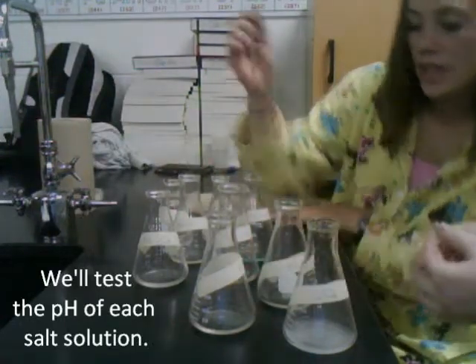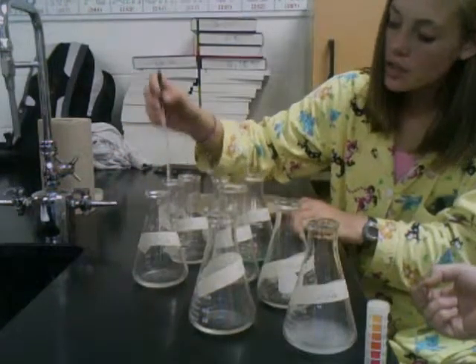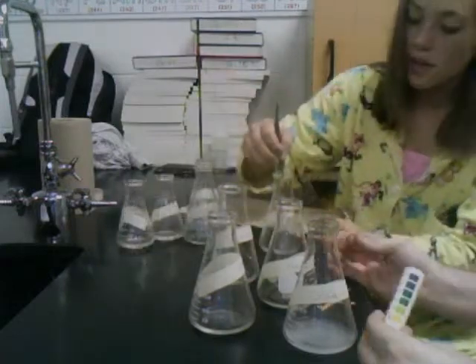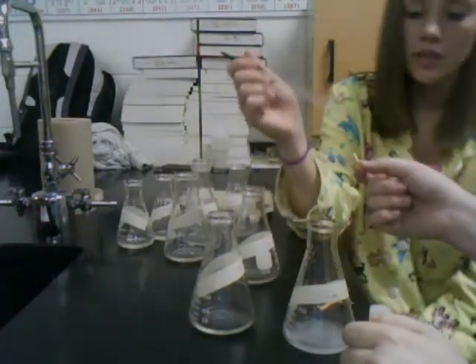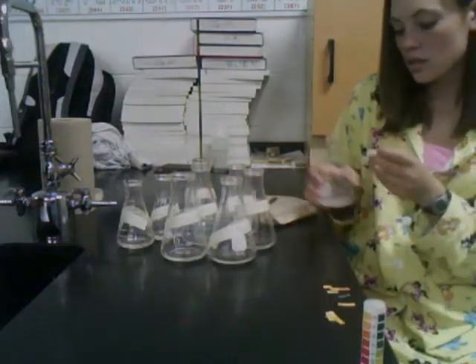The color of the pH paper appears to be neutral. One more salt, potassium chloride, which we are getting now.